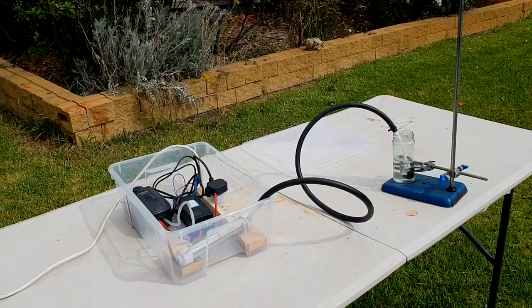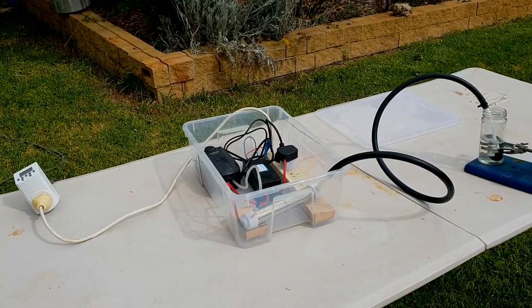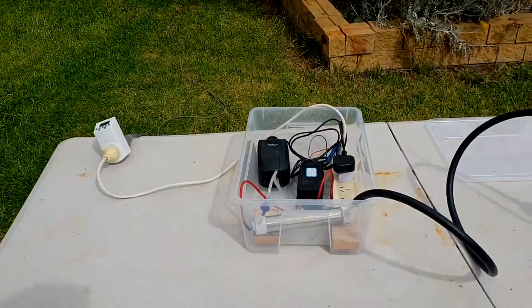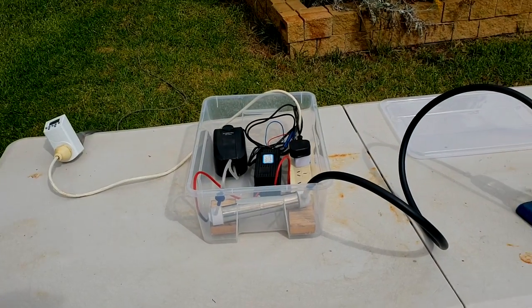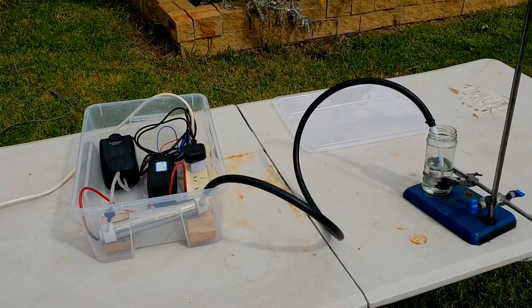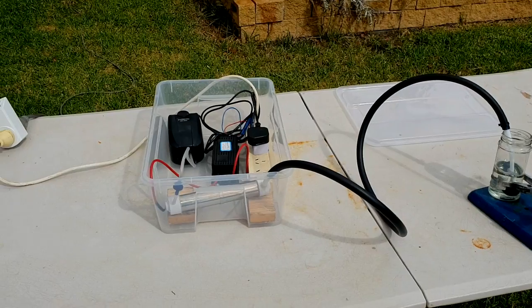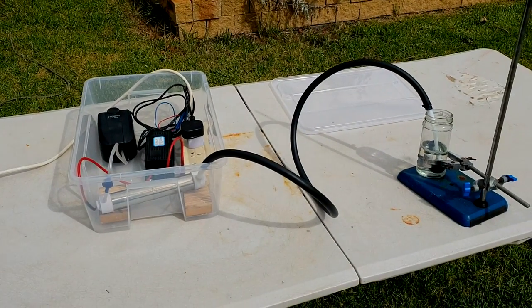That will help us out a lot, but I'm pretty happy with what we've achieved today. We've got the system just running. We're going to have to run this for many more hours before we get a decent yield out of it, so I'm just going to pack it up for today. We'll run it another day for some more hours. Hopefully the cooling system turns up.